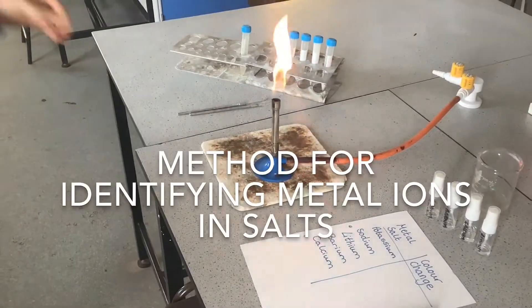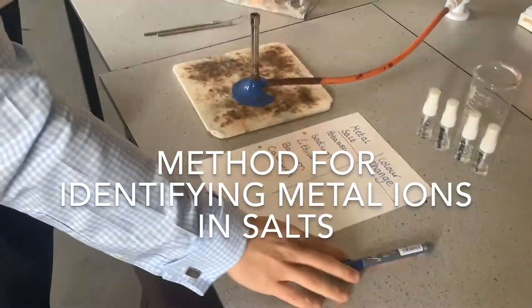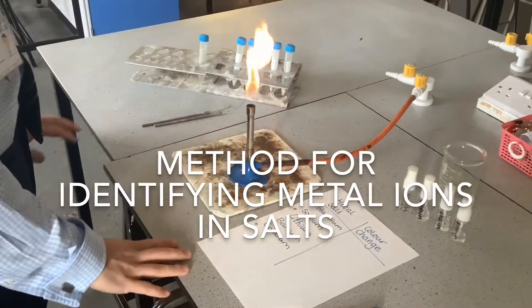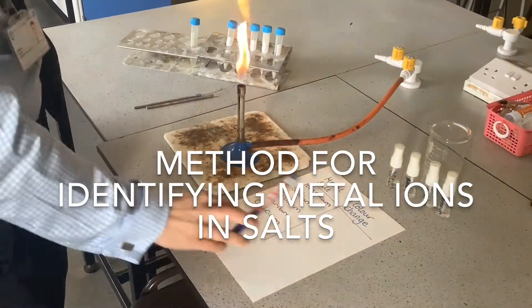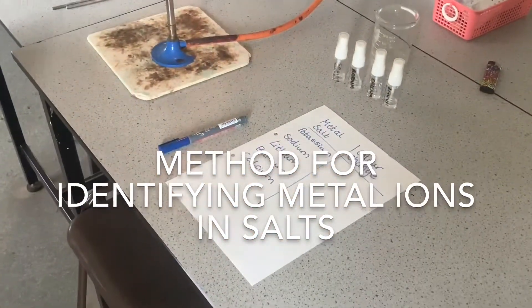We're looking at another specified practical today. We're looking at identifying metals in salt. I've got my table of results drawn up already.